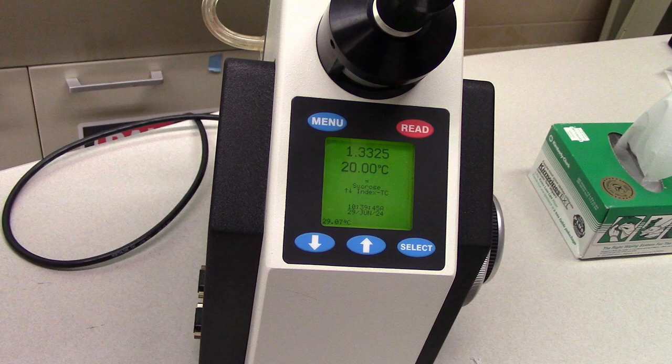The refractive index will change with the concentration of ethanol in solution, meaning that the refractive index can, in turn, be used to estimate the concentration.